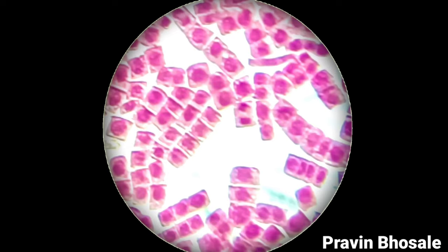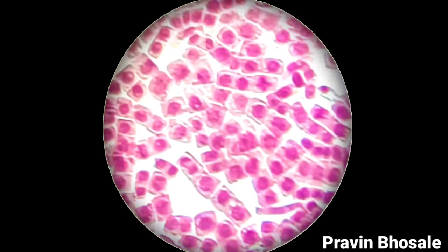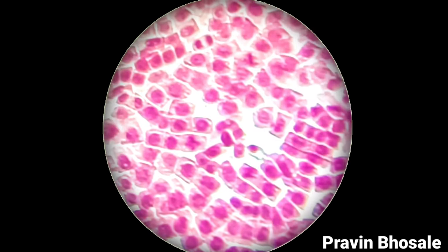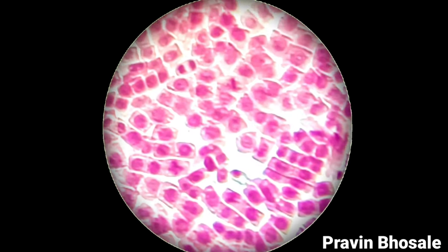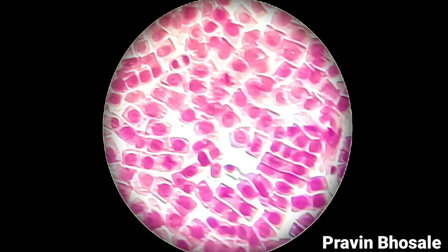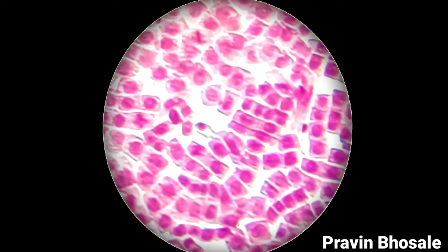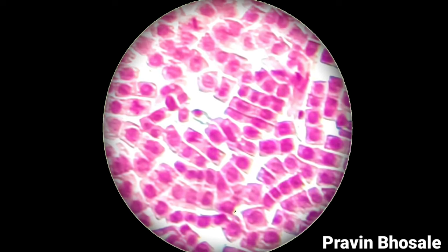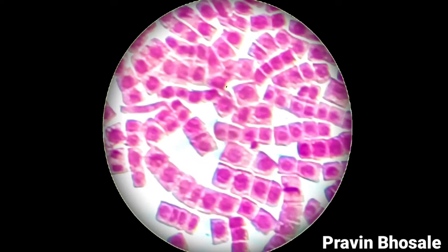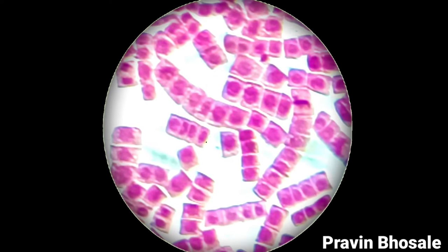In maximum cells you'll be observing prophase. Very few cells you'll see metaphase, anaphase, and telophase. The stain I've used is acetocarmine because it stains the chromosomes.